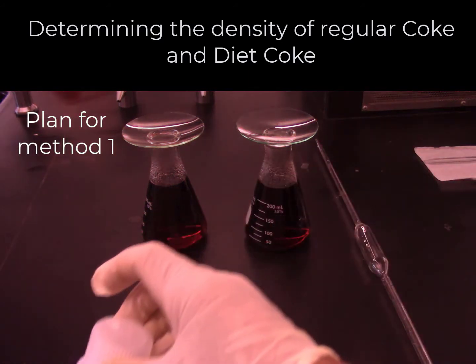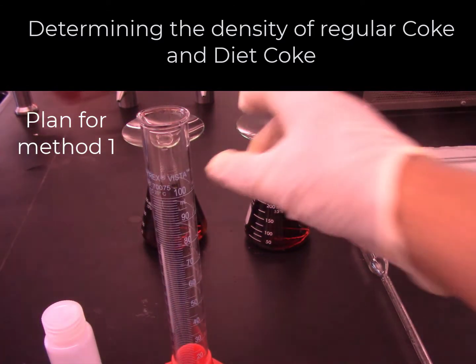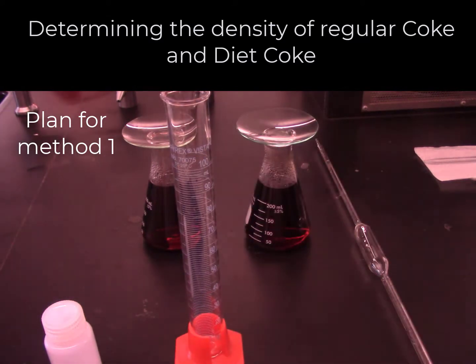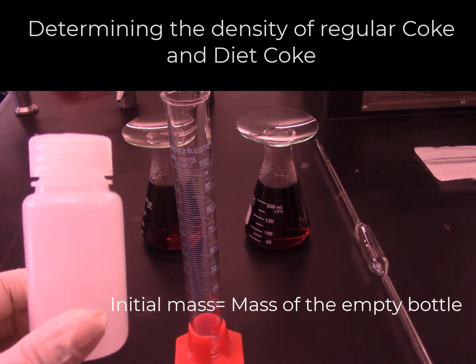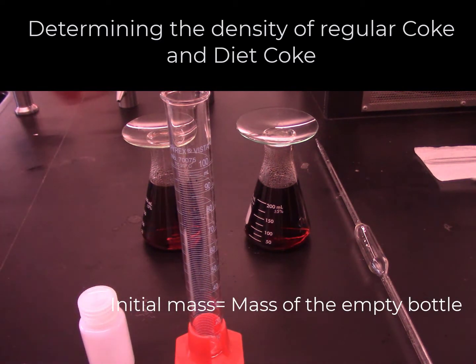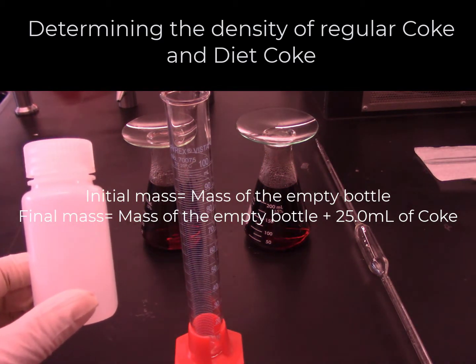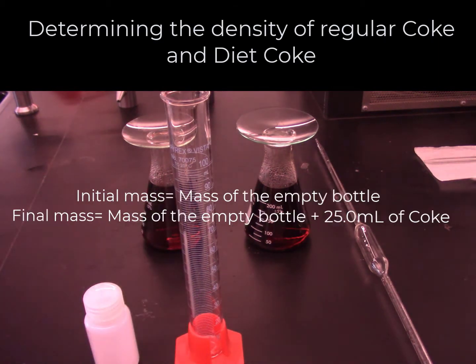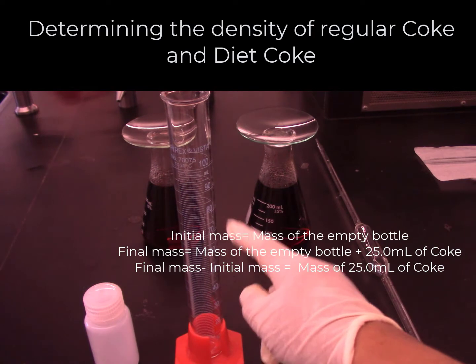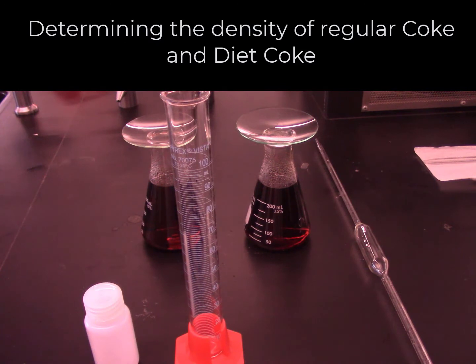I will use this white plastic bottle to measure the mass of Coke, and I will use the measuring cylinder to measure the volume of Coke. First, I will measure the mass of this bottle. It will be the initial mass. I will transfer 25 milliliters of Coke from the graduated cylinder into the plastic bottle and measure the final mass. The final mass minus initial mass is the mass of Coke. We will know the volume and the mass of Coke and we can calculate the density of Coke. Now let us carry out this plan.